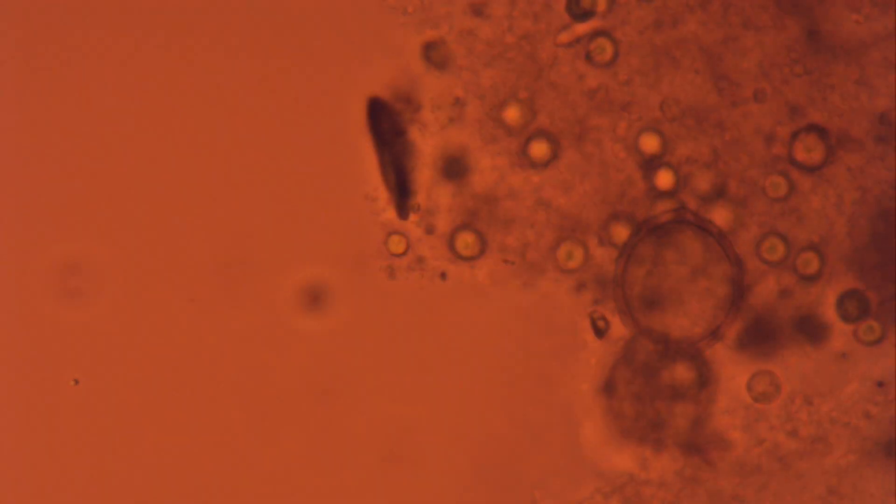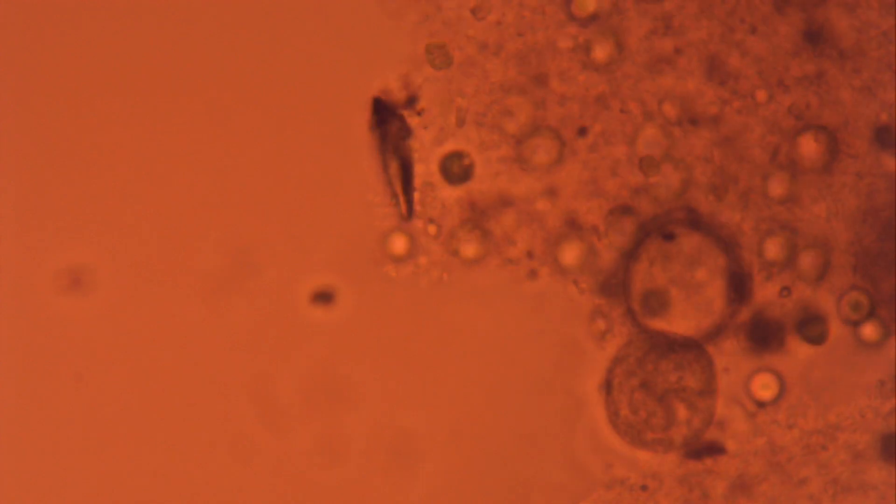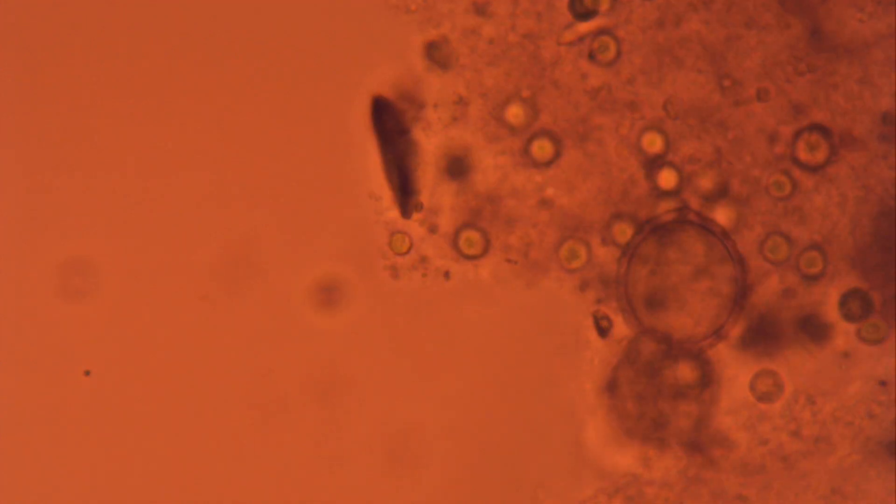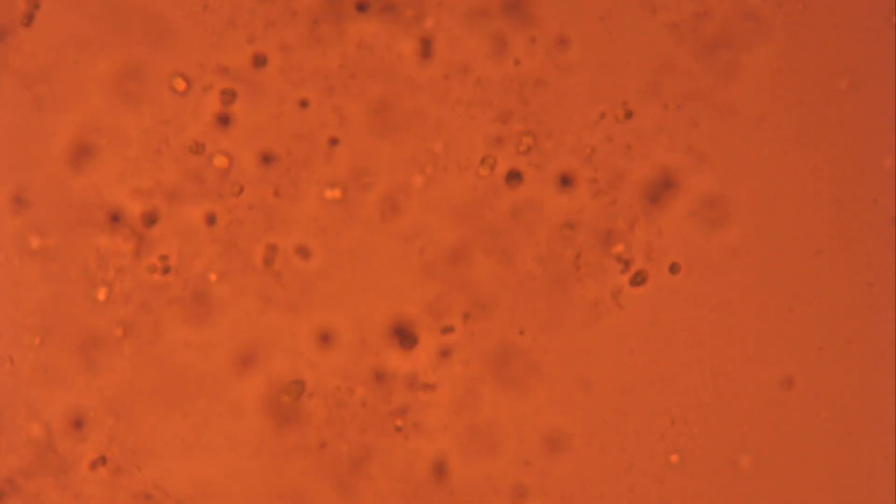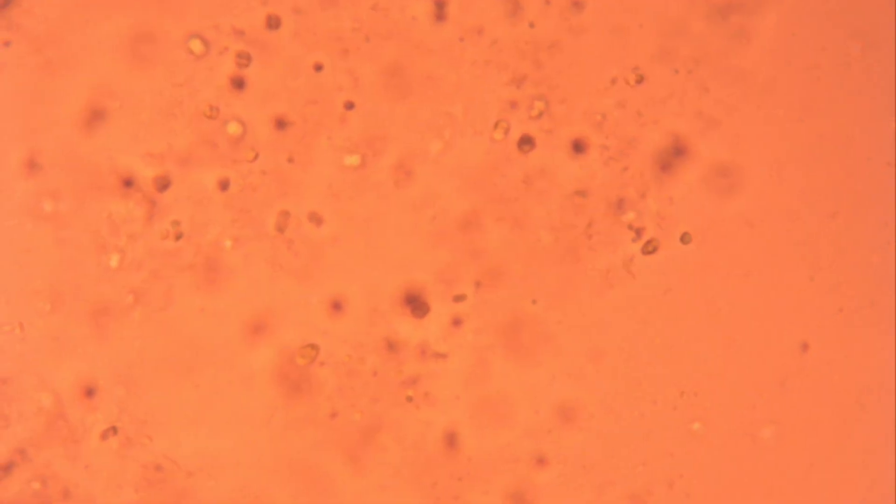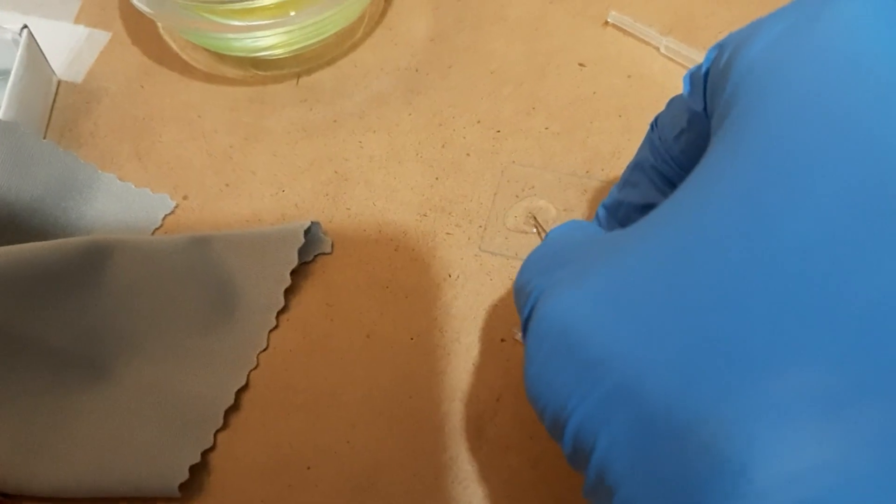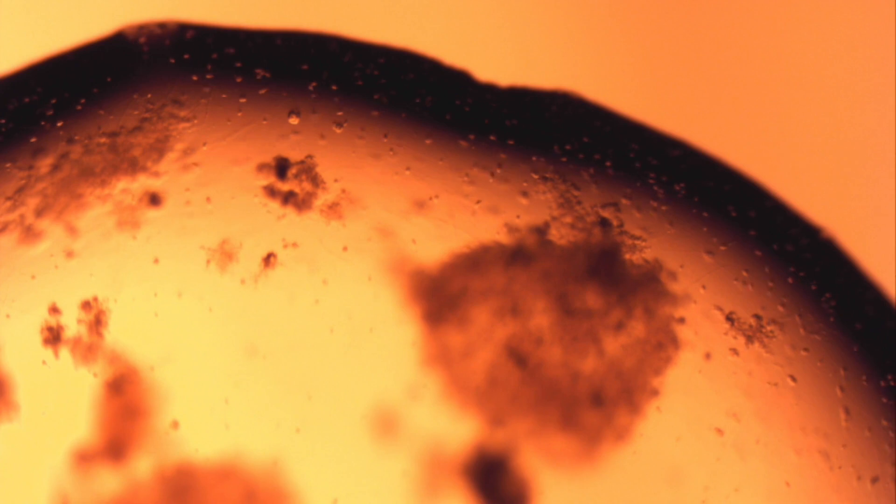I put a coverslip over it to get a better look. I try again, but this time I use a tiny sewing pin and will tap a small amount of hand sanitizer into the drop, hopefully disturbing it less.